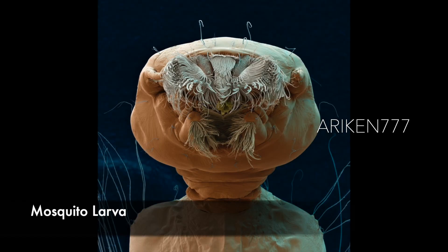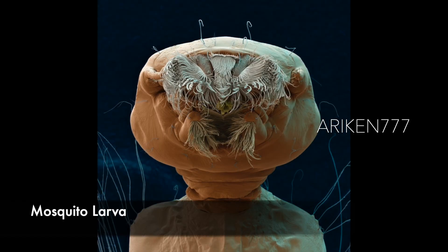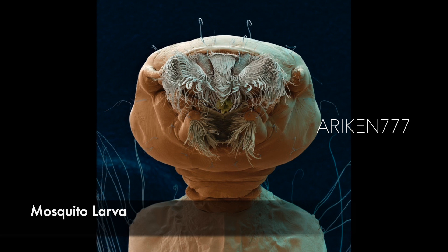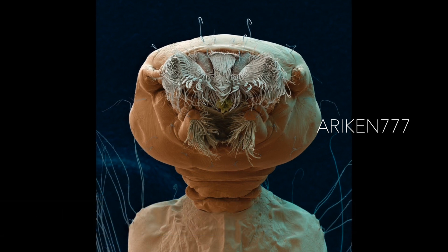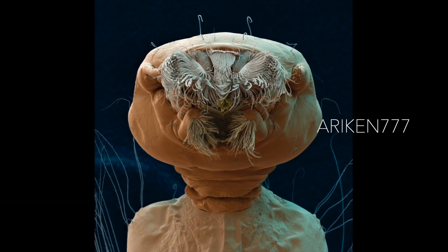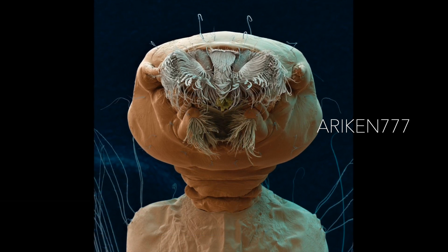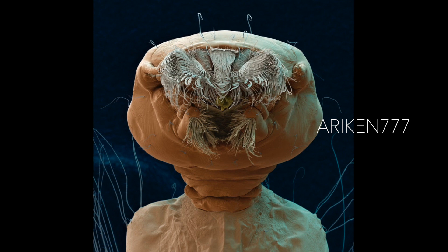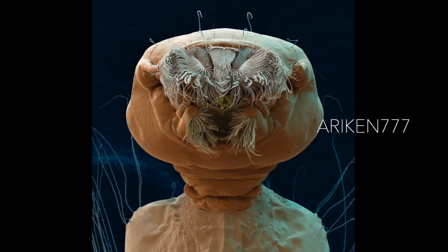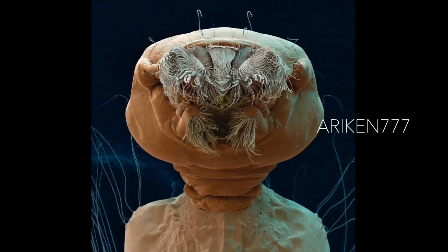A mosquito larva — as a baby, it feeds on algae and other microscopic organisms. It spends most of its time at the water's surface before pupating into an adult.